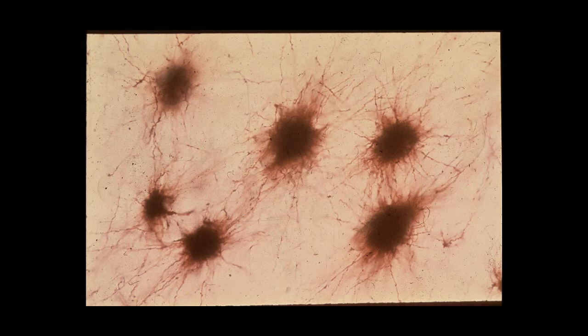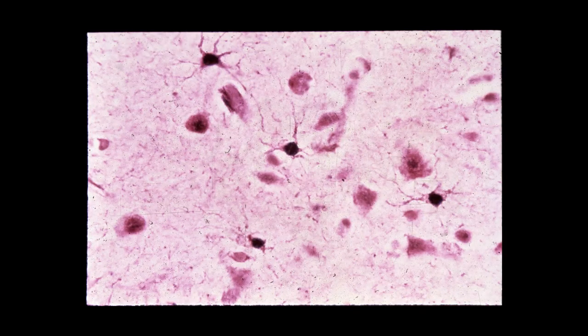This is not a course in neurobiology, so I'm not going to ask you to really be able to distinguish protoplasmic versus fibrous astrocytes. As you become more experienced, you'll be able to identify areas in the central nervous system that are gray matter, because those are the areas where you find the cell bodies of neurons, as opposed to the white matter where you essentially are just finding the axons and no cell bodies.